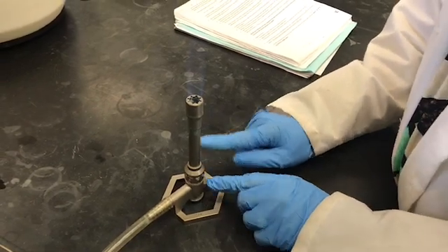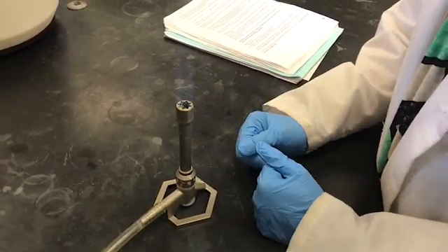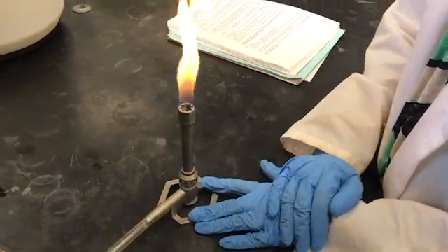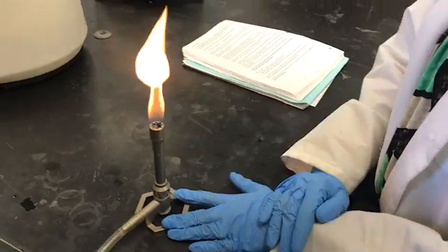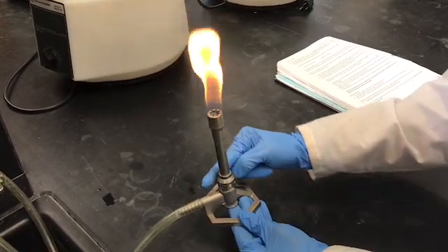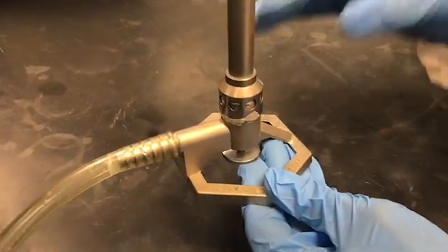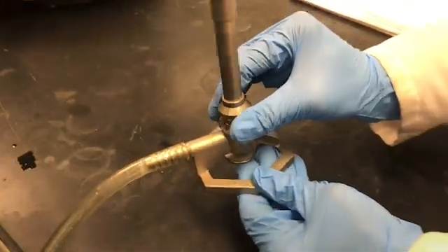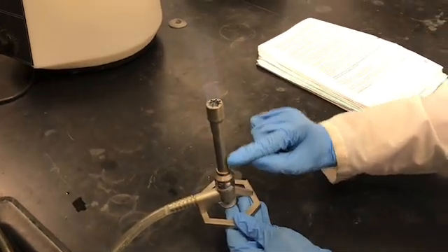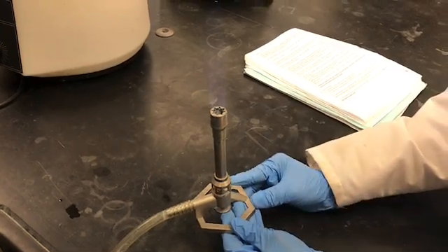Now we'll learn about flame adjustment. If I close the barrel completely, the flame turns yellow. Yellow means incomplete combustion — I'm restricting the oxygen supply by closing the air vent. To get the blue flame back, I open the barrel so more oxygen mixes with the methane, producing the blue flame.